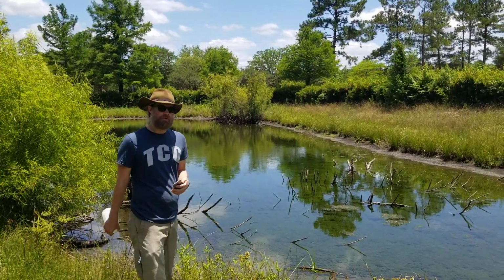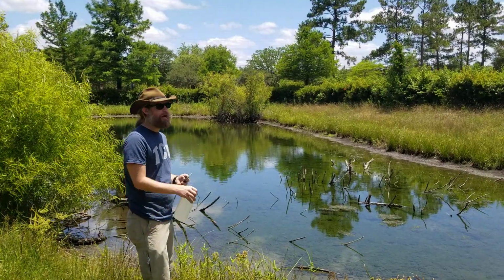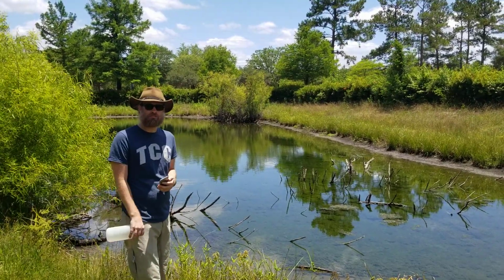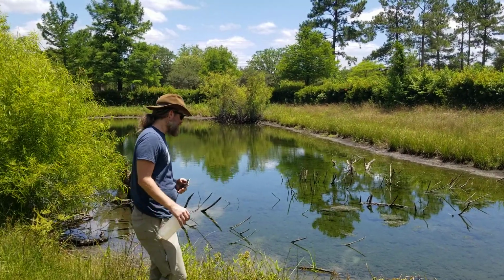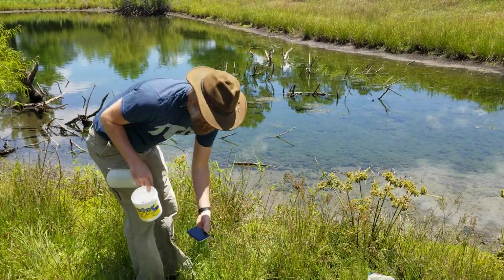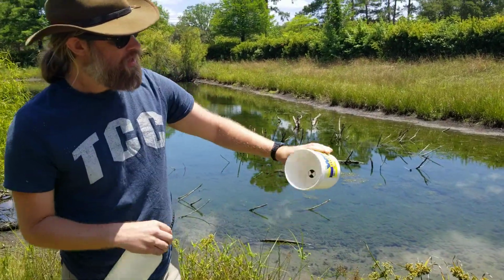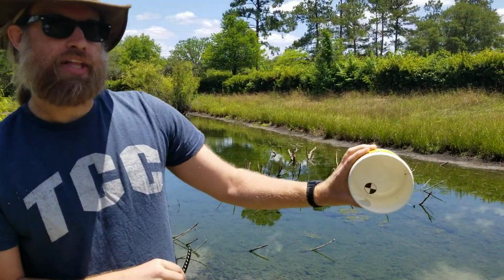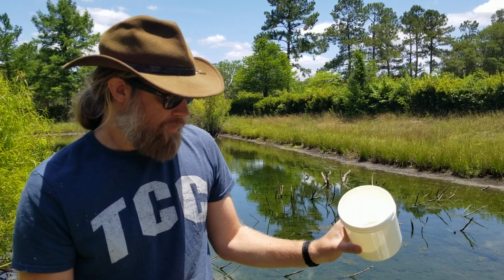So again, the first thing I'm going to do is take a couple of water samples to measure turbidity and water temperature, and then grab some water to take back to the lab so we can measure some chemistry like pH, nitrates, phosphates, things like that. To measure turbidity, I'm going to use this fancy bucket right here, and it has this little target in the bottom. If the water is murky, we're not going to be able to see that target very well compared with if it looks nice and clear.